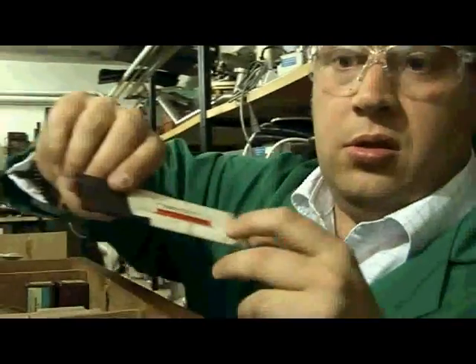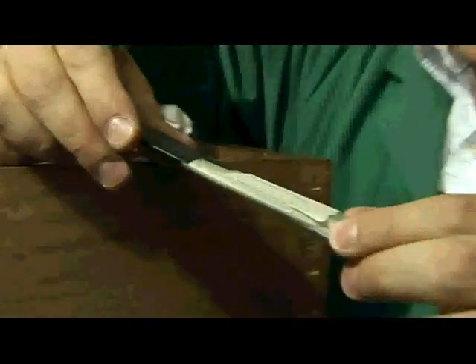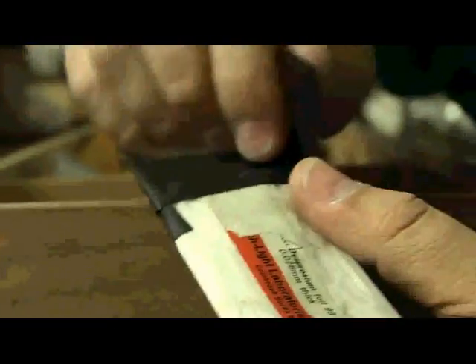Here you can see we've got a very thin foil sample of dysprosium. It's from the bottom end of the periodic table, very, very reactive, stored very, very carefully as a foil. Now if we open very carefully, we might see if the metal is still there.